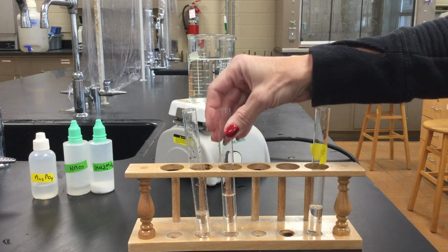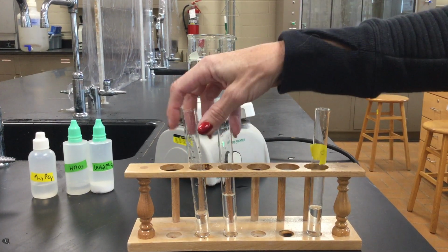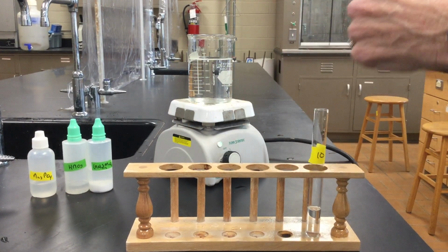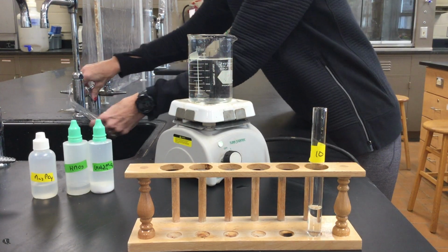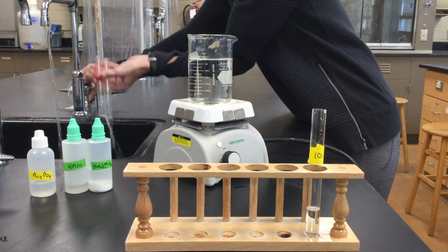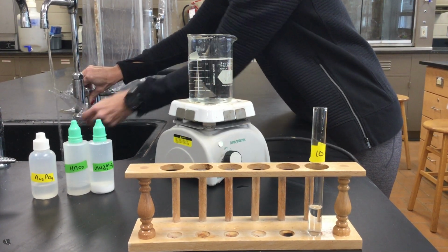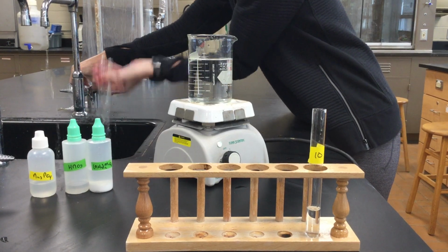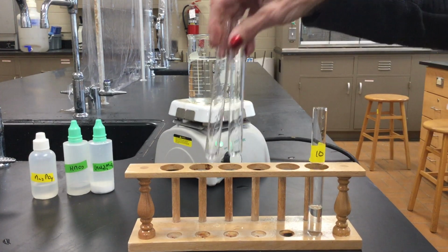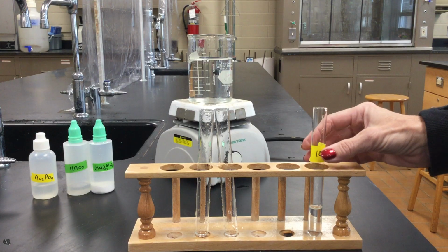Then when we added the hydrochloric acid to our unknown, it didn't do anything. There was no gas forming. So again, that means that our unknown is not bicarbonate. And so on to our last test, which by process of elimination means we should have phosphate as our unknown, but we're just going to do the tests and see what happens, see what results we get.